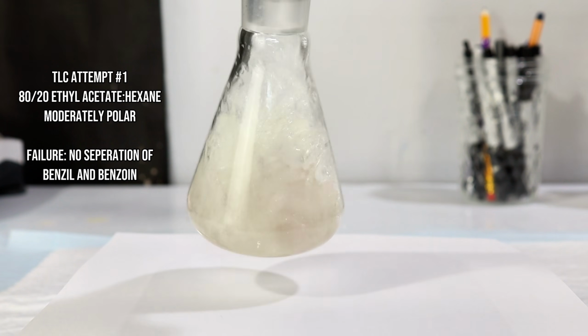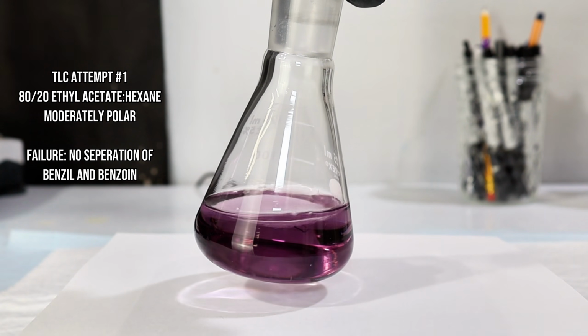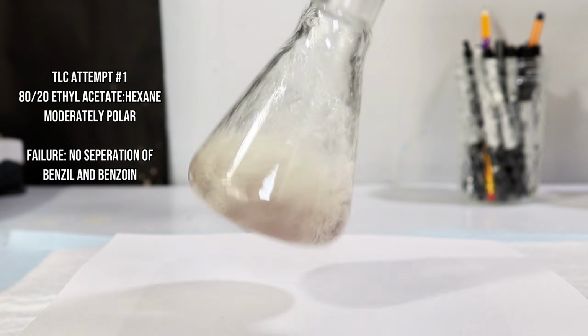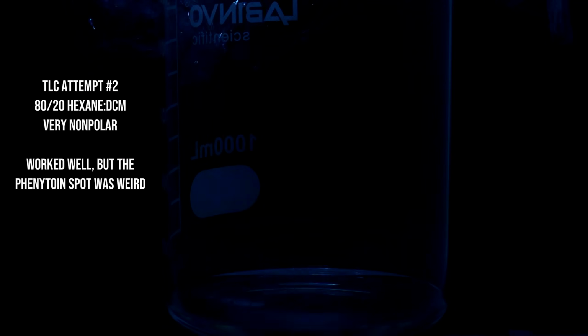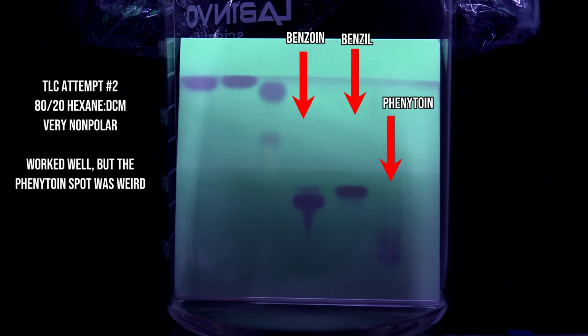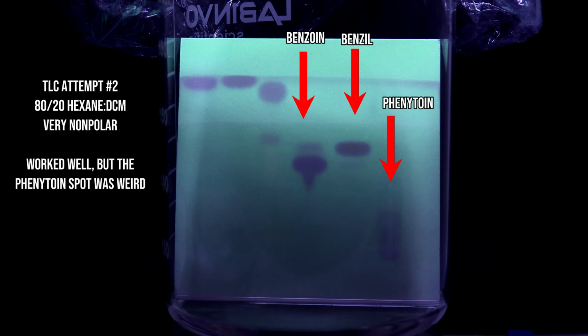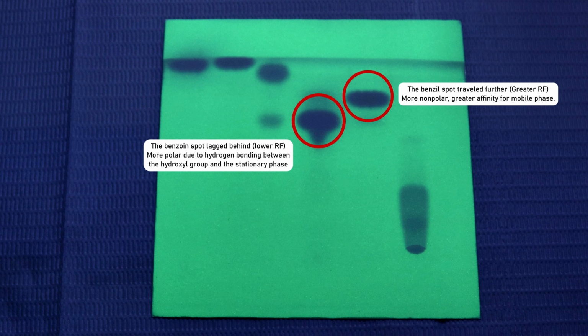Now, the problem with this first TLC run is that the benzil and the benzoin moved along the plate at basically the same rate, while the phenytoin lagged only slightly behind. To try and fix this, I decided to run this a second time using an 80-20 mixture of hexane and dichloromethane, and in this significantly more nonpolar mixture, the separation was a good deal better. Taking a closer look at the plate, you can see that the benzil traveled further with the more nonpolar mobile phase than either of the other samples.